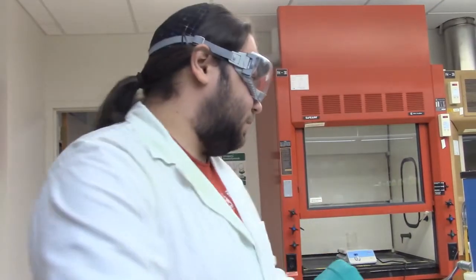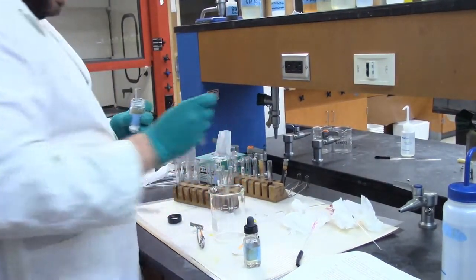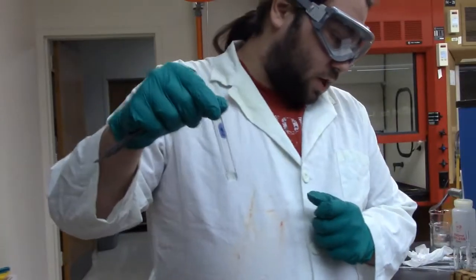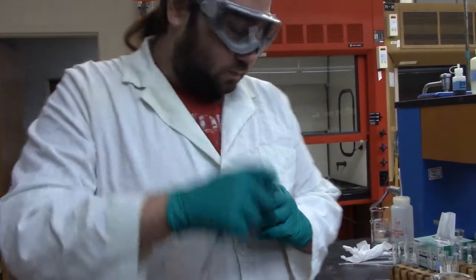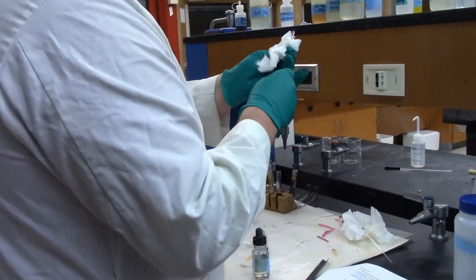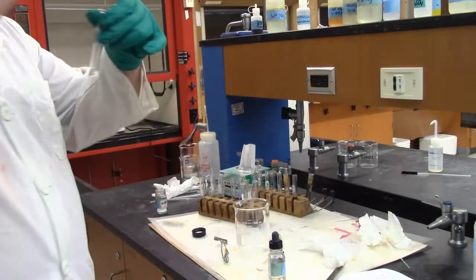So, we're going to add some NaF to that, some sodium fluoride. I know the name of that one. Going to add a tipful. Not all that much going on there. We'll add another tipful for the fun of it. And that is all stained pink. Oh gosh. And some of the nail polish remover now. Pepto-Bismol. We'll give it a good mix.